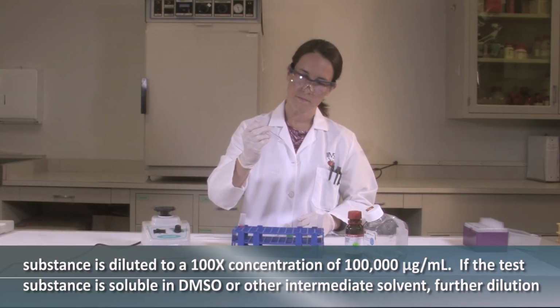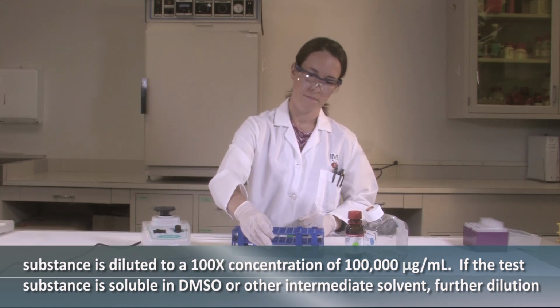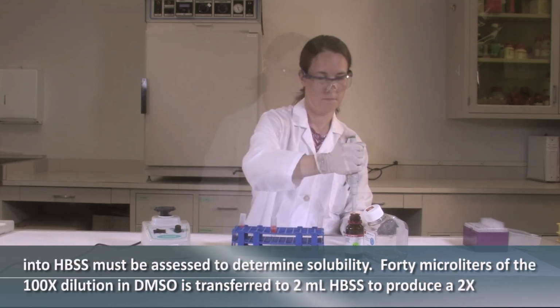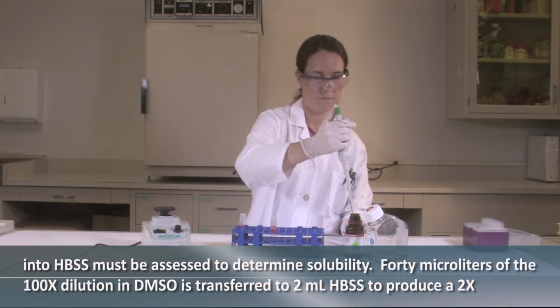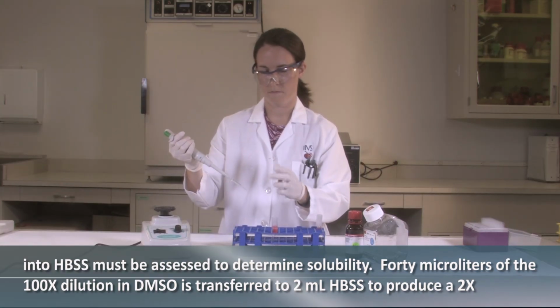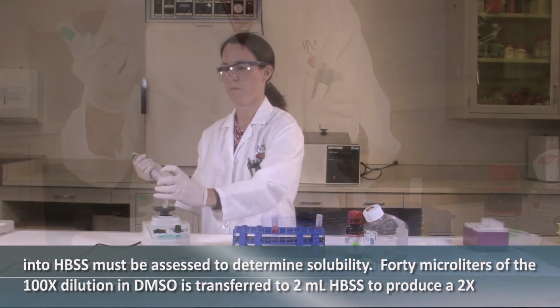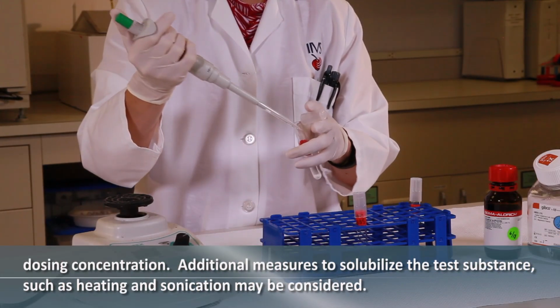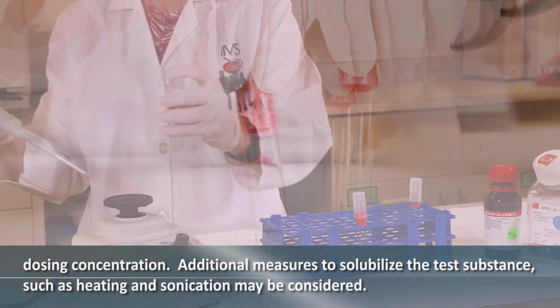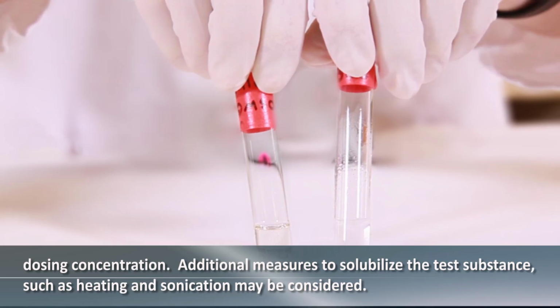If the test substance is soluble in DMSO or other intermediate solvent, further dilution into HBSS must be assessed to determine solubility. 40 microliters of the 100x dilution in DMSO is transferred to 2 milliliters of HBSS to produce a 2x dosing concentration. Additional measures to solubilize the test substance, such as heating and sonication, may be considered.